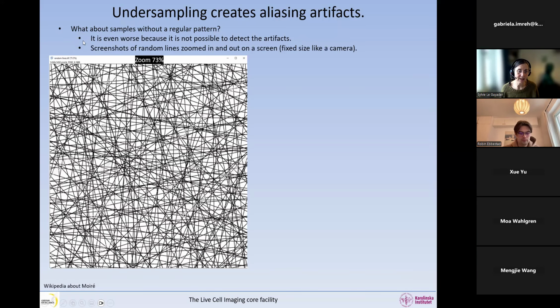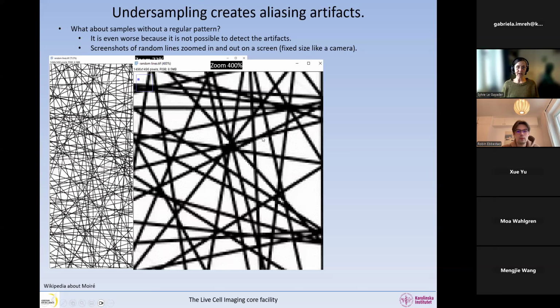So now I want to show you this random line sample. This is something that you can get from Fiji, and it creates random lines. Okay. So I have this line pattern and it's a pattern, but it's not a regular pattern. And I'm going to zoom the image in and out, and that is, of course, overlaid with the screen pattern. The screen has a pattern, right? So when I zoom into the image, what I can see is that I have some digitalization artifacts. So these lines are jagged because we are taking discrete samples. And we also see at the places where the lines cross that we have this big black blob, which normally we shouldn't have. But this big black blob is because we cannot resolve these. Okay, so that's what we are seeing. And in here, it's the digitalization artifact.